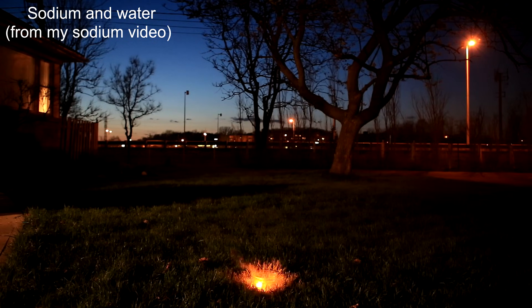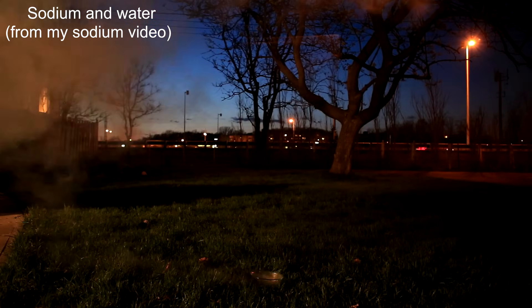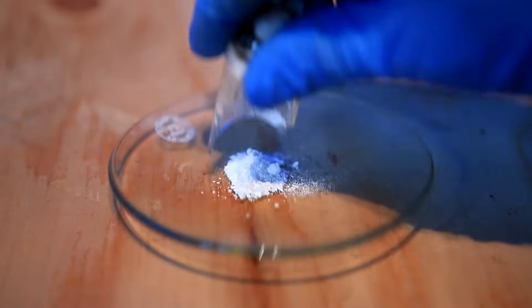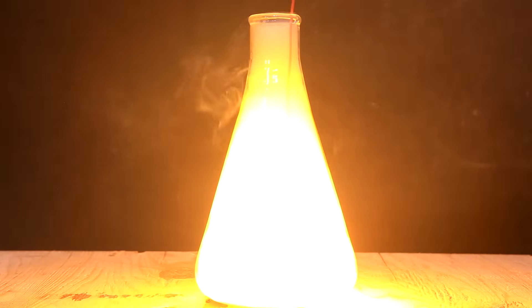On their own, both elements sodium and chlorine are pretty reactive and dangerous. However, interestingly enough, when they are combined, they form a nice edible salt. This is an interesting demonstration that shows how drastically different the properties of a compound can be compared to its components.